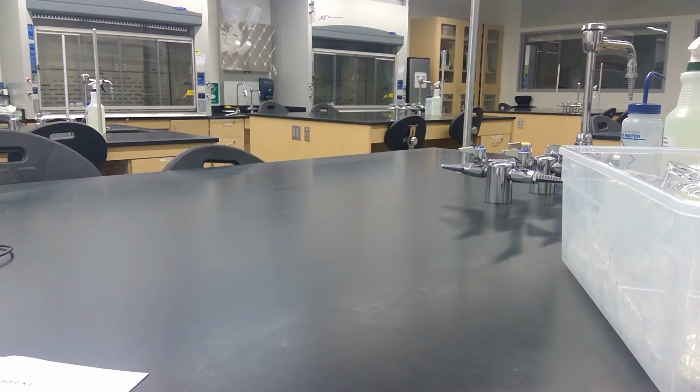Alright, so this video is for Lab 1 of Chemistry 104, Introduction to the Chemistry Lab. And the procedure says, introduce yourself to your lab partner and get their contact information. And introduce yourself to the teams at your workbench. So you'll be working at student benches where 4 students can fit.